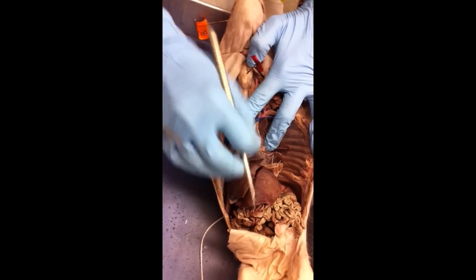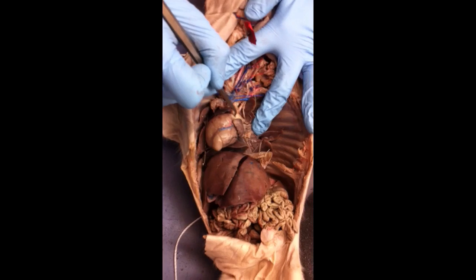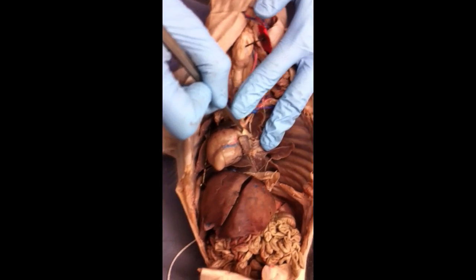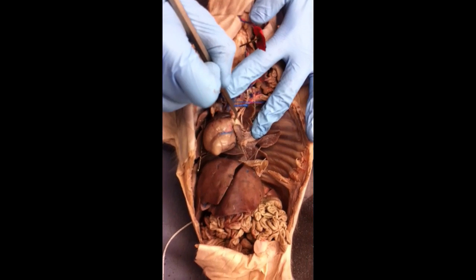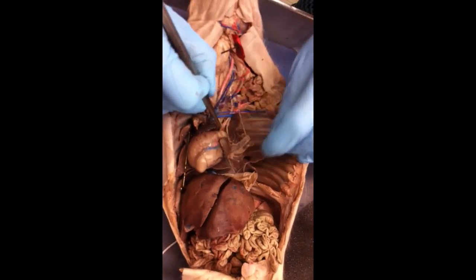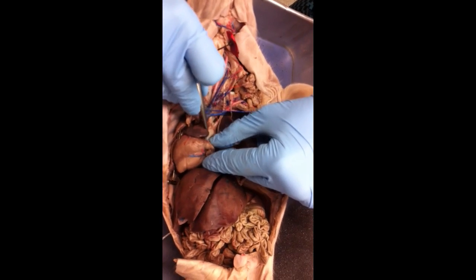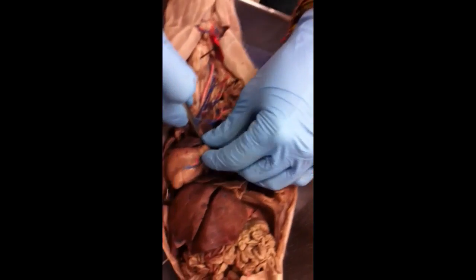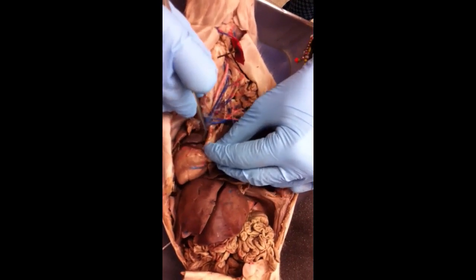So if you see a pin right here, that's asking for what? Where the probe is. The one in front is the pulmonary trunk. So this is carrying what? Deoxygenated blood from the heart to the lungs. Okay. The one right behind it. How come it's not blue? They just don't. It didn't take up the dye well. And usually you won't really see these two dyed as well as the rest of the arteries and veins. They'll usually be just tan in color.